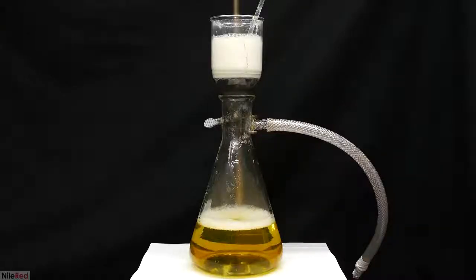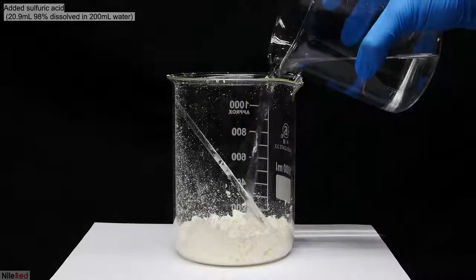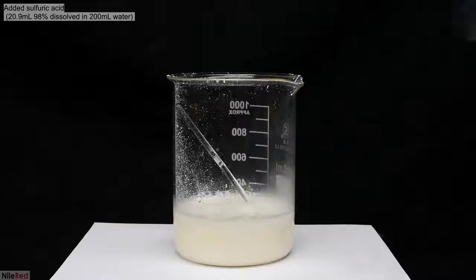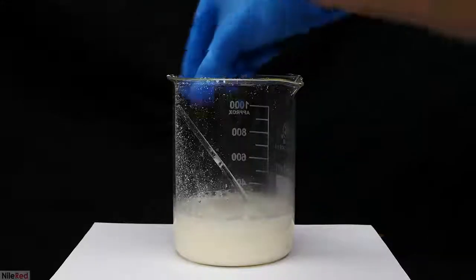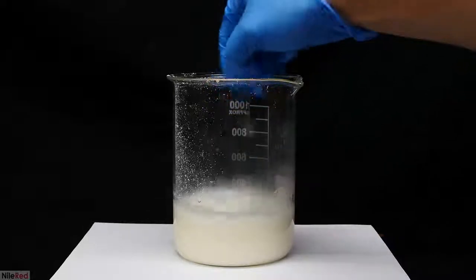The filtrate below has a pretty strong orangey yellow color. The pH of this waste is close to neutral, and there's nothing toxic or dangerous about it, so it can just be poured down the drain. All of the calcium citrate is then transferred to a beaker, and I pour in some sulfuric acid. It's important to note that the sulfuric acid I'm using here is not concentrated, and it's pretty heavily diluted in water. Anyway, once it was added, I used the glass stir rod to thoroughly mix everything together.